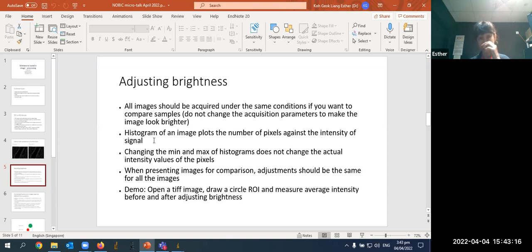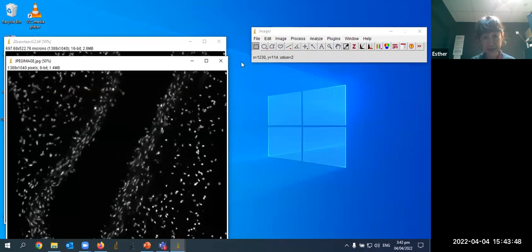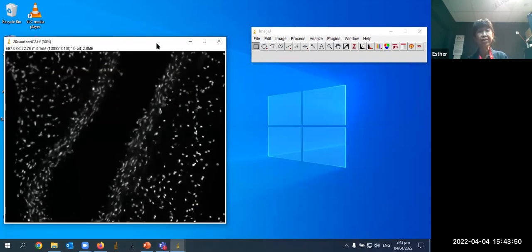So the histogram is actually just every digital image has a histogram that plots the level of brightness on the x-axis and the number of pixels of each level of brightness on the y-axis. So we can control what brightness to display in the image. This is done by changing the minimum and maximum values of the display histogram, which I will also show you. So let's go there now, back to ImageJ. I will use this one, the TIFF image. Let me close this. Okay.